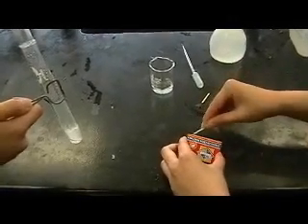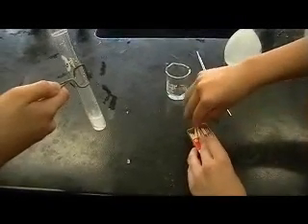You will hear a pop, and listen carefully to the one that happened in this experiment as it is very quiet.